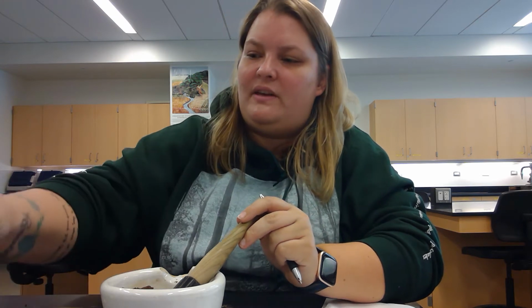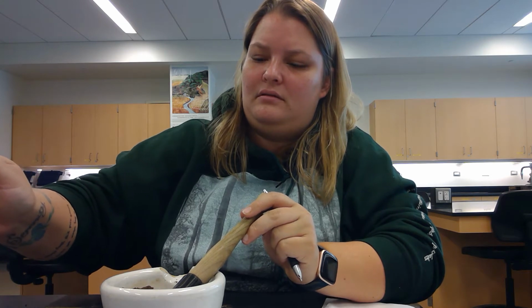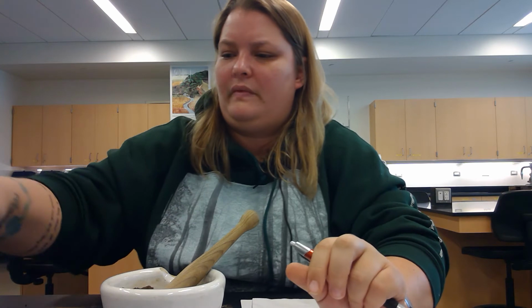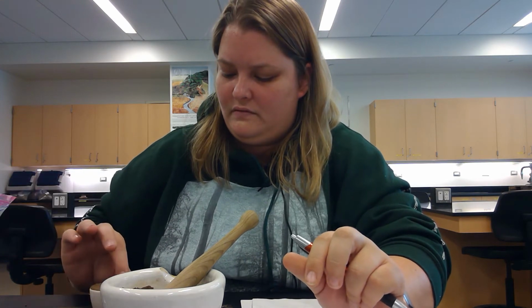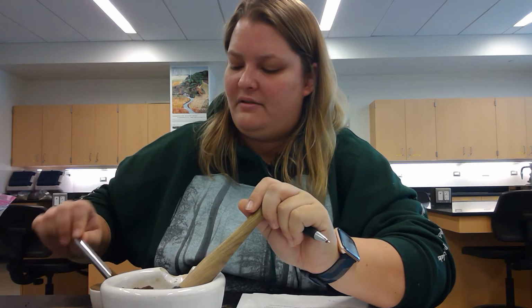I don't always do that. There's a little bit of plant residue in that.